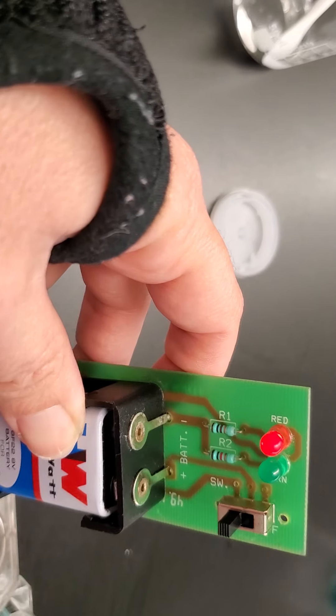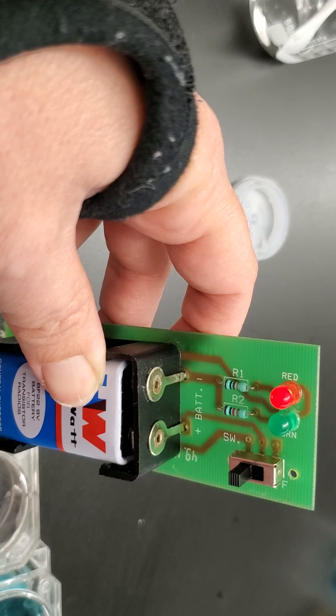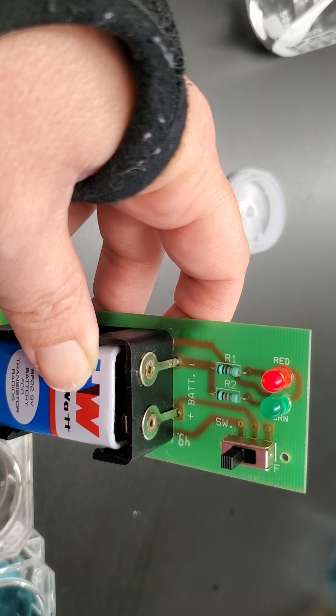Sample two—the red one, you can see, is not as bright as the previous one, and the green one's still not on.